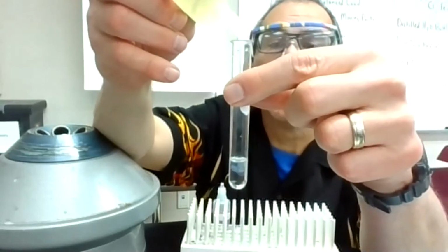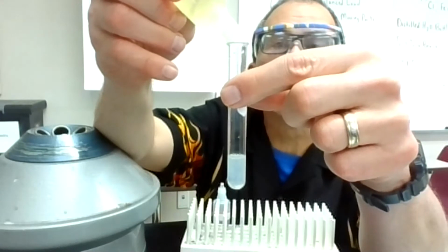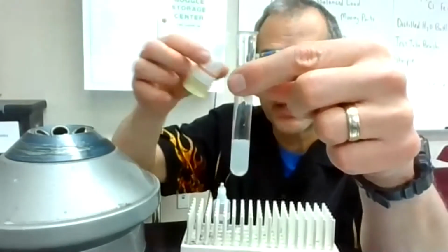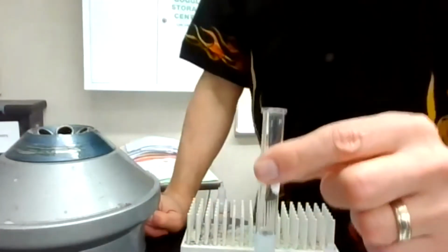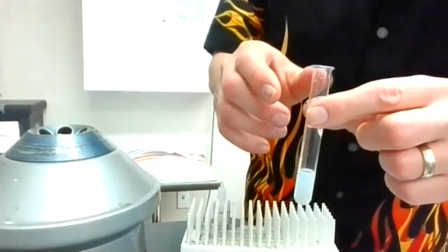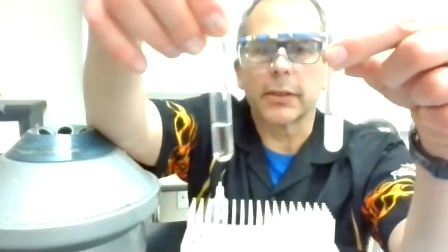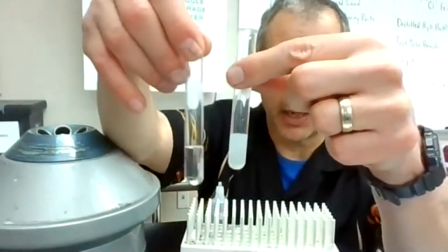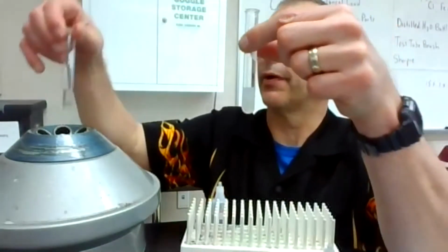So I'm going to go to my next step, which is adding the Fe(CN)6 4-, and we'll take a look. 1, 2, 3, 4, 5, 6, 7, 8, 9, 10. So I definitely see some clouding up stuff. If I have another test tube here, which I thought I have, but apparently I don't. Need a little blank solution. Here we go. Here is distilled water right here, and here is my solution now. You can definitely see the cloudiness there. You can probably pick that up as I was adding the drops.